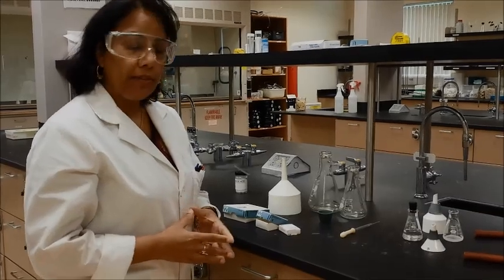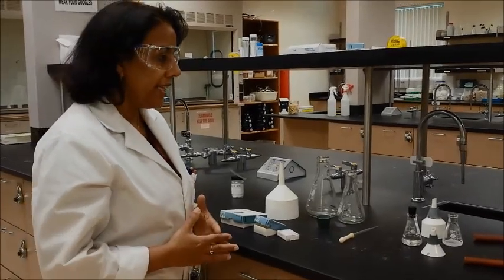So let me show you how to set up for a vacuum filtration, which is a very common technique in organic chemistry.